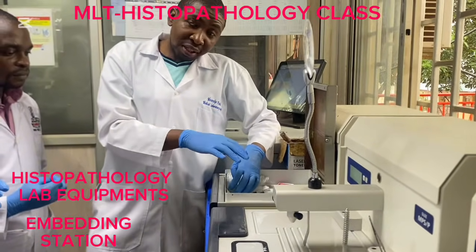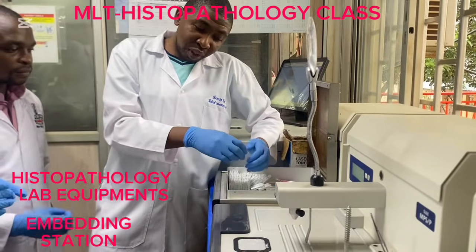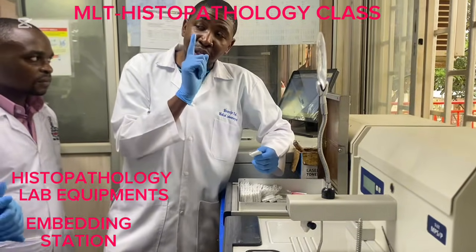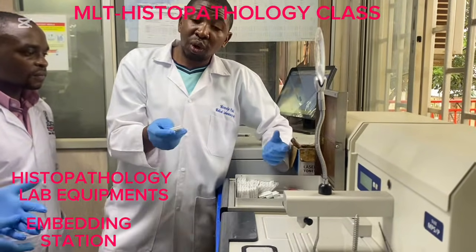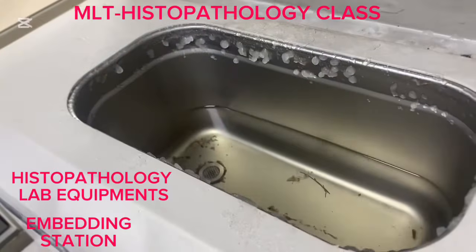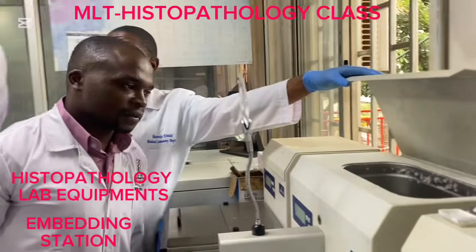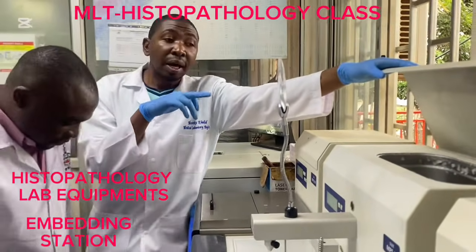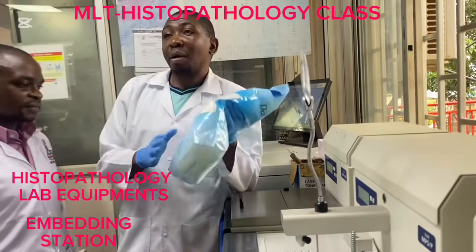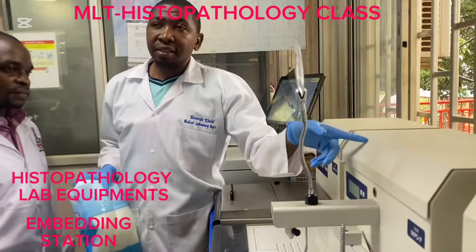Okay, number one, to ensure that the remnants of paraffin wax are removed, but most importantly to keep it warm, to prevent the tissue from becoming brittle when you leave it to open environment. And number three, we have wax tank or wax reserve. So that's where we put our paraffin wax, of course in solid form. This paraffin wax pellet in solid form. So when we pour in, it will melt.